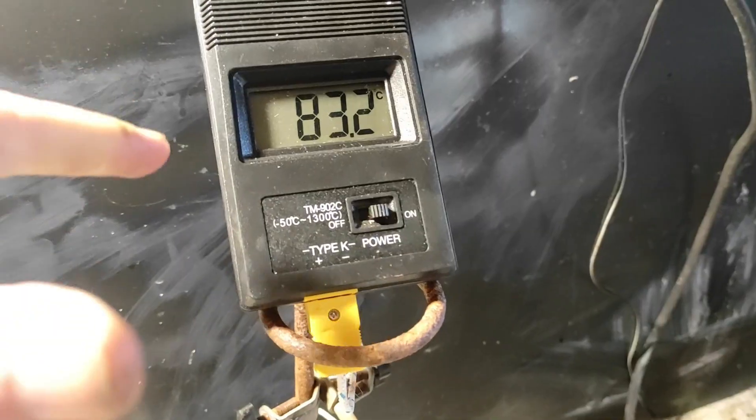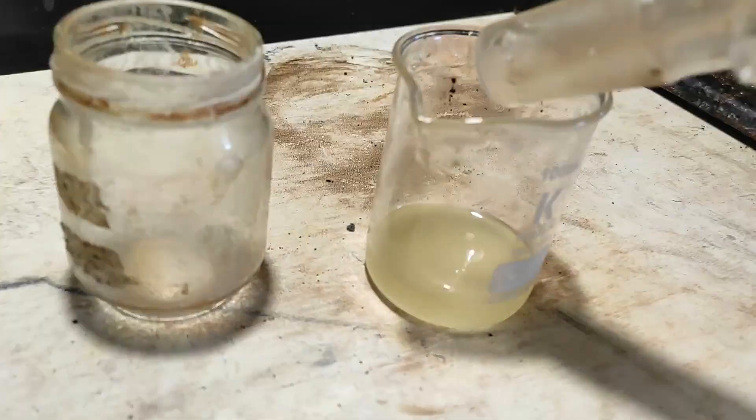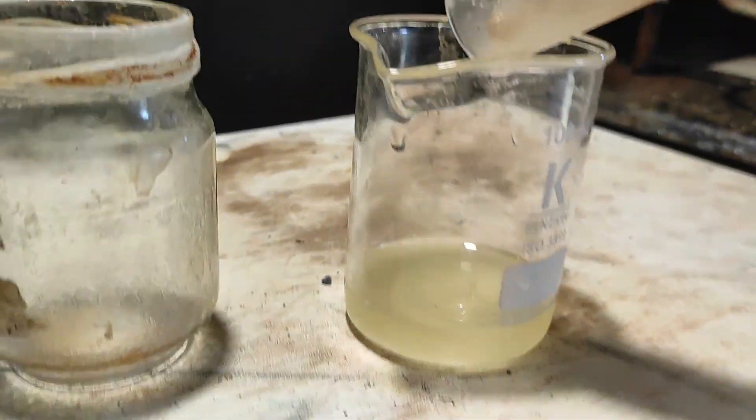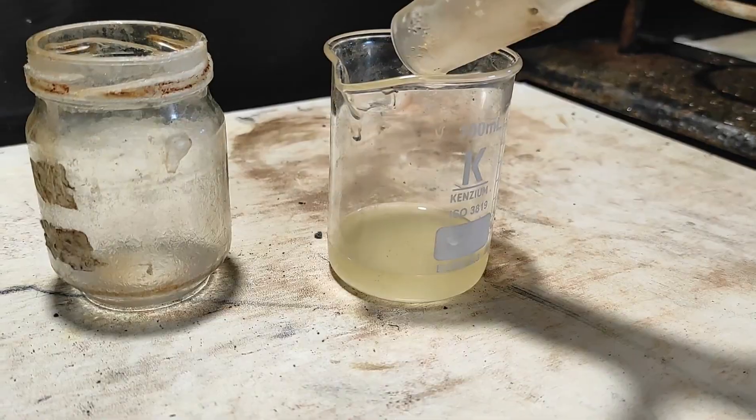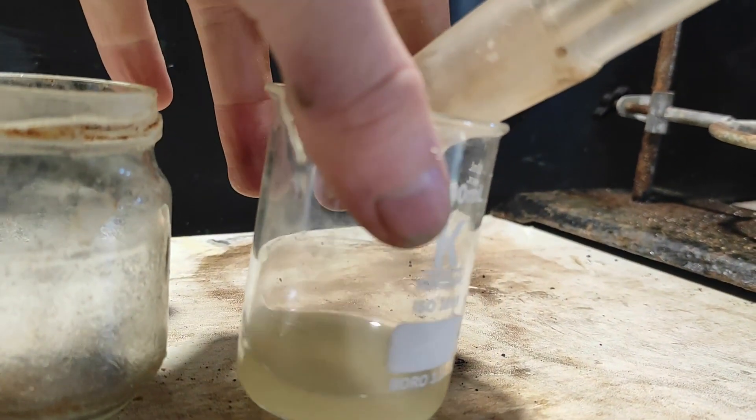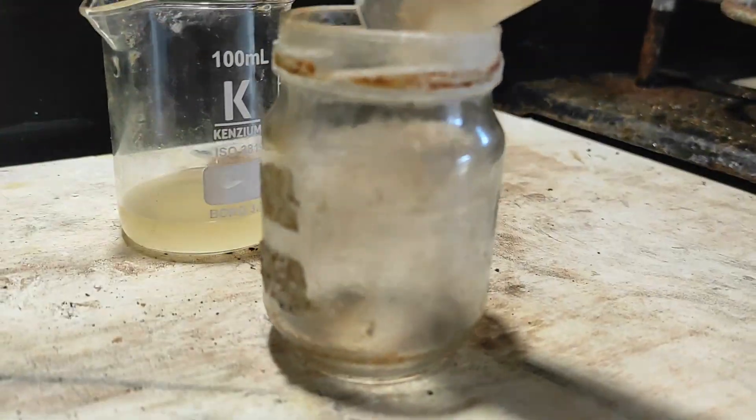Okay, so the temperature is getting higher and higher, and right now, let's change the flask, because there is probably not much more benzene in here. I don't want to collect shit. But here, you can see the rate has much, much slowed down. So, here.